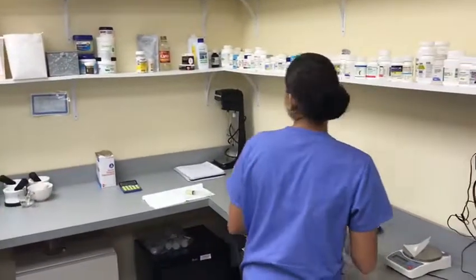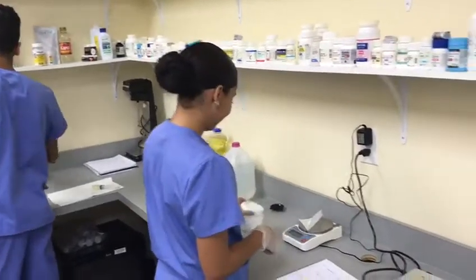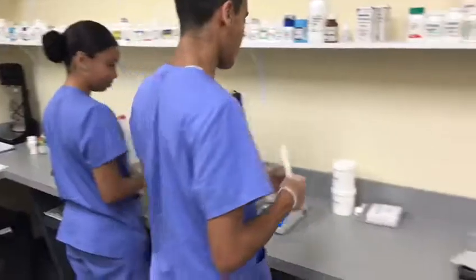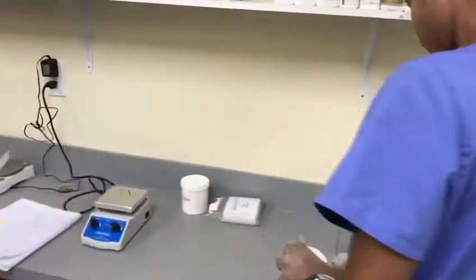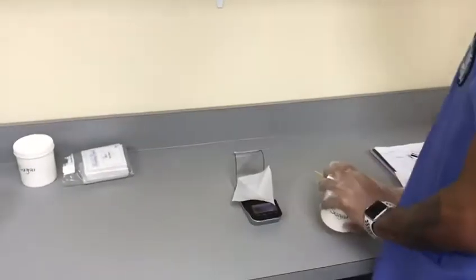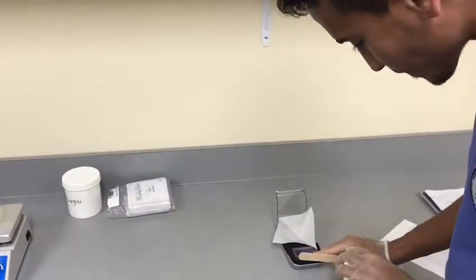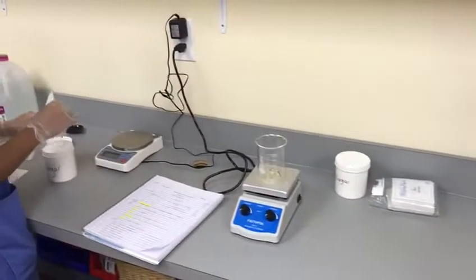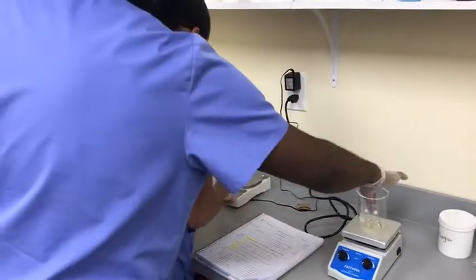We have some conversation between colleagues regarding the actual formula, and we have Carlos who is using a carat weight scale to weigh out the second ingredient after properly calibrating the scales. My class is continuing to navigate through the formula.